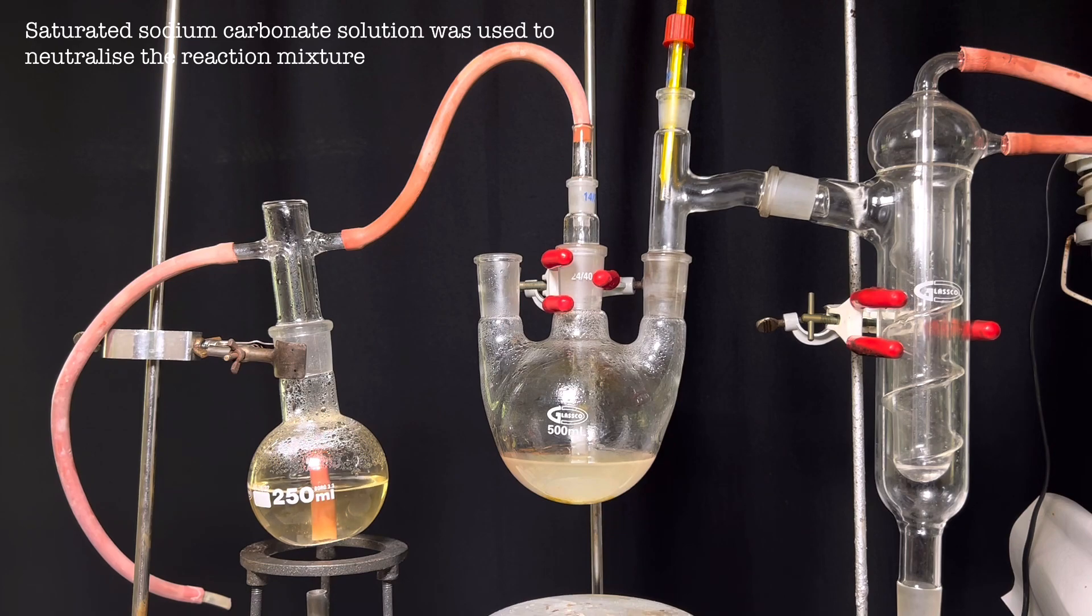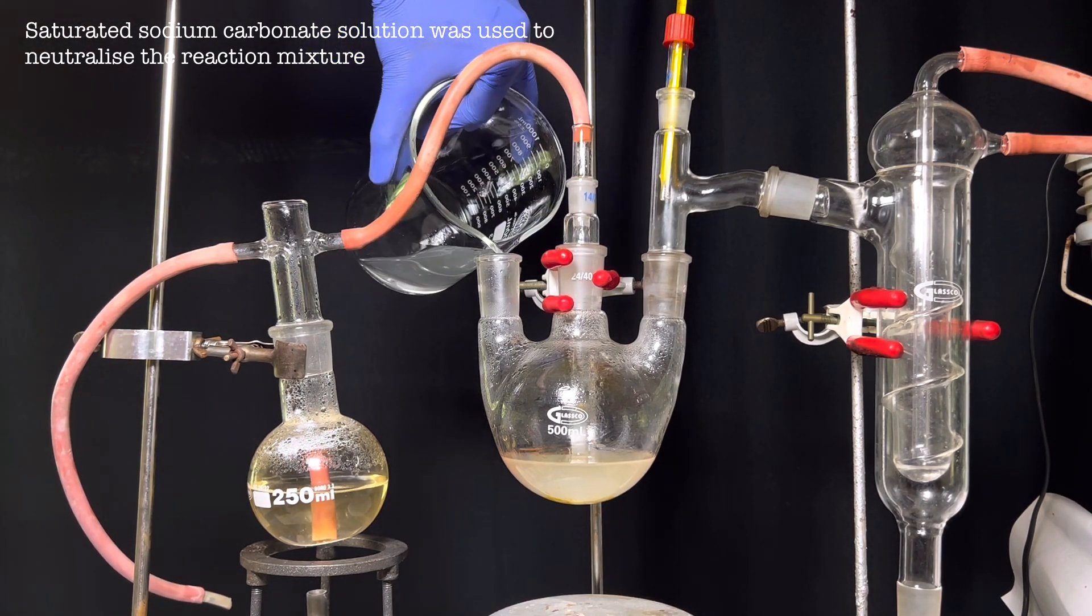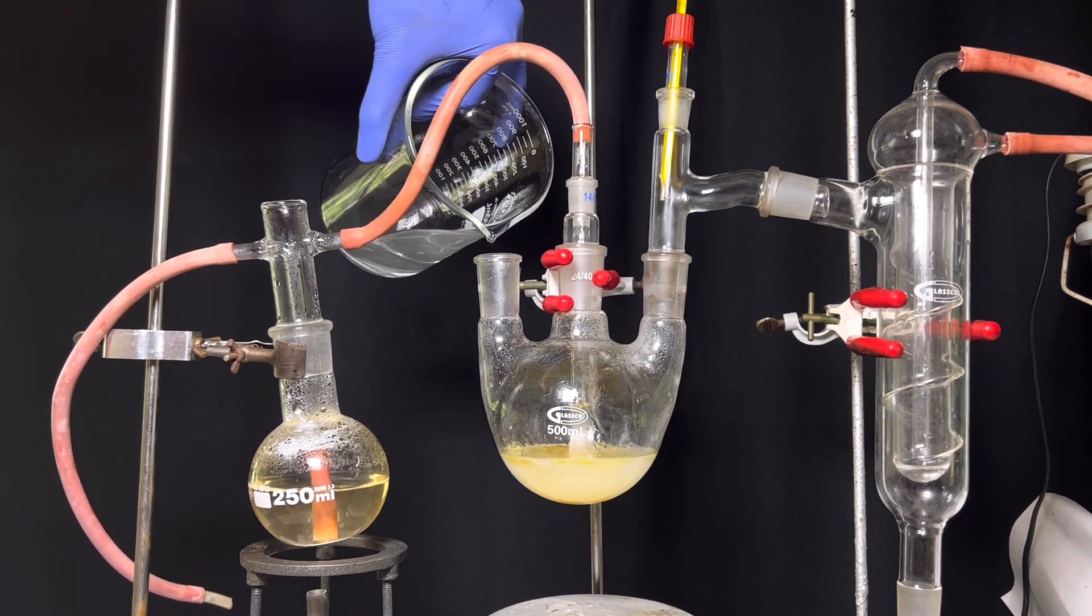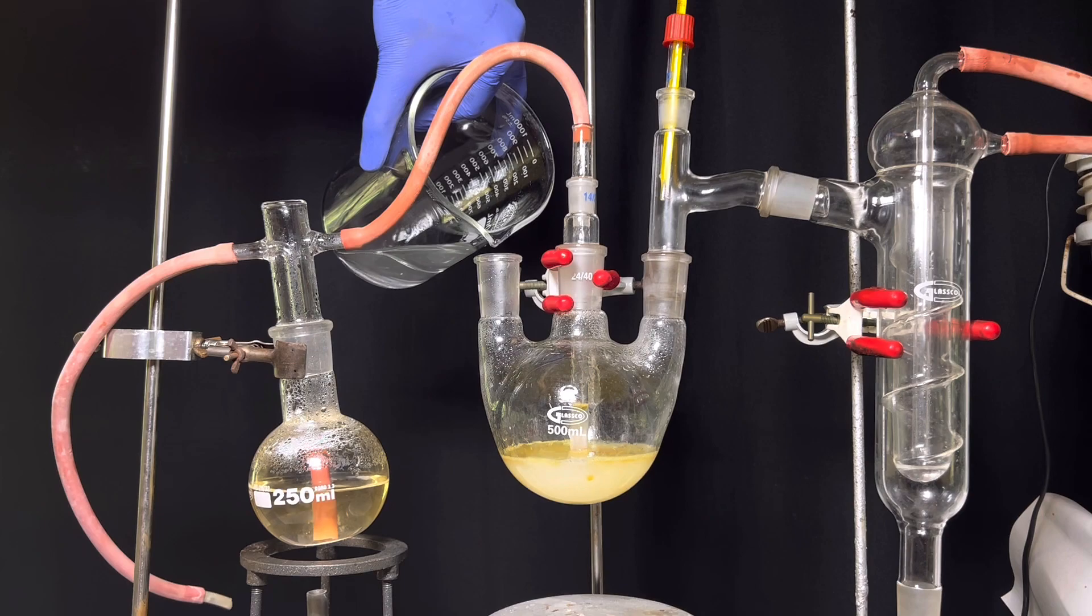Then, a saturated sodium carbonate solution was added to the reaction flask until the pH gets to neutral. This can be very easily noticed as the effervescence will stop when it gets neutral.